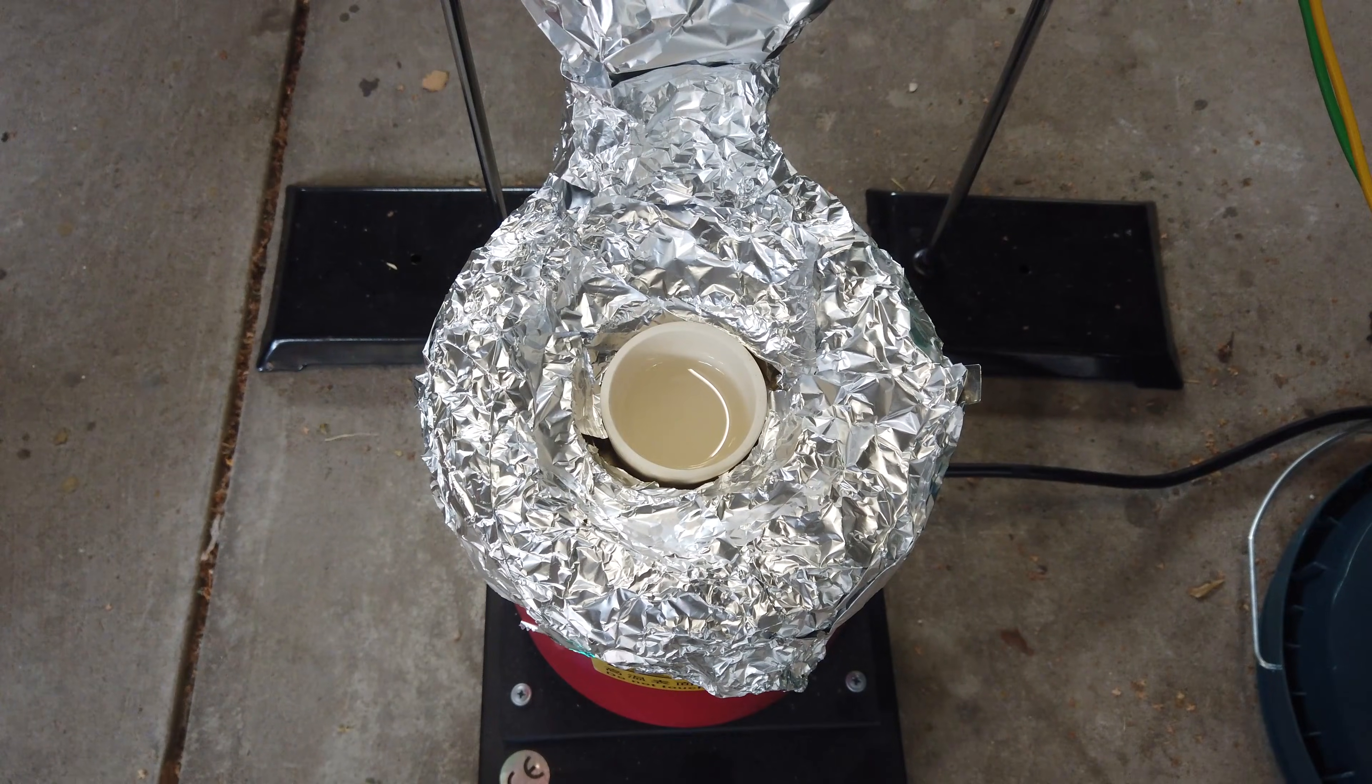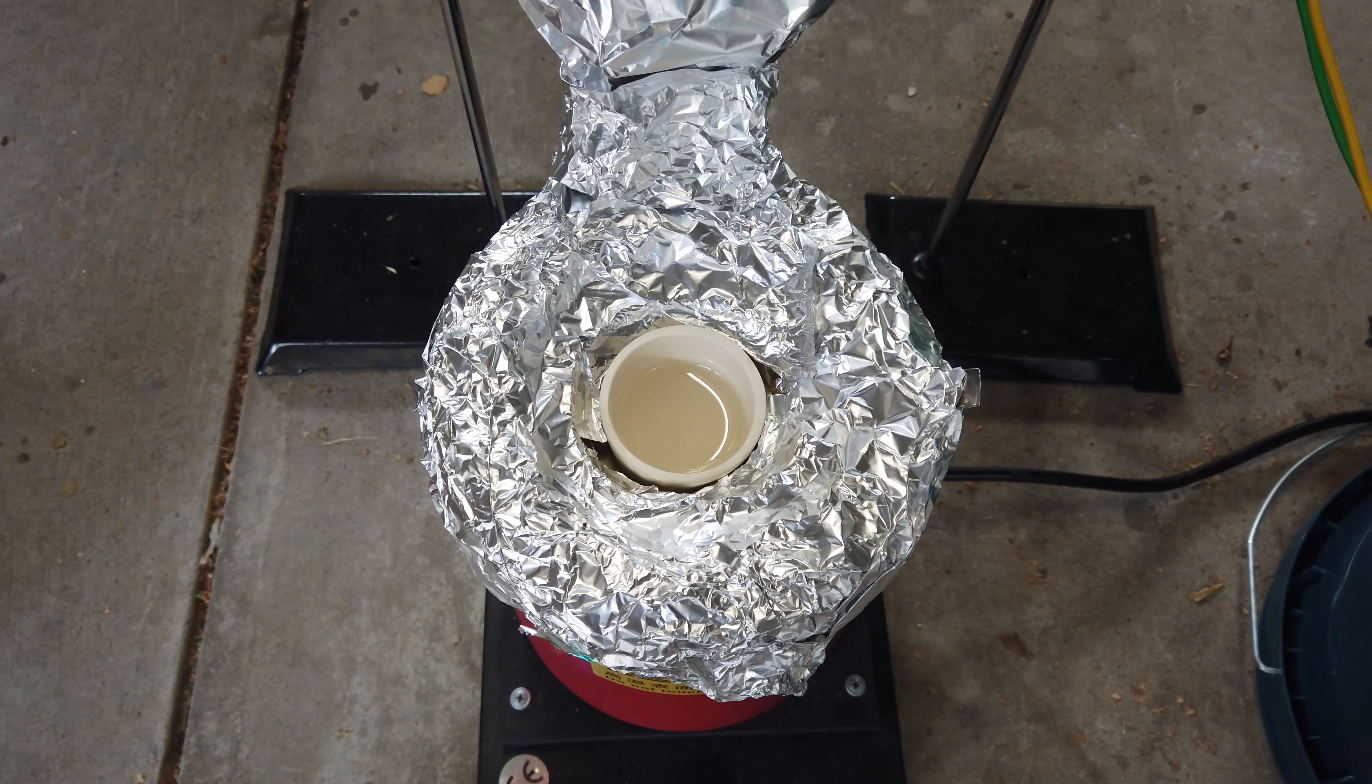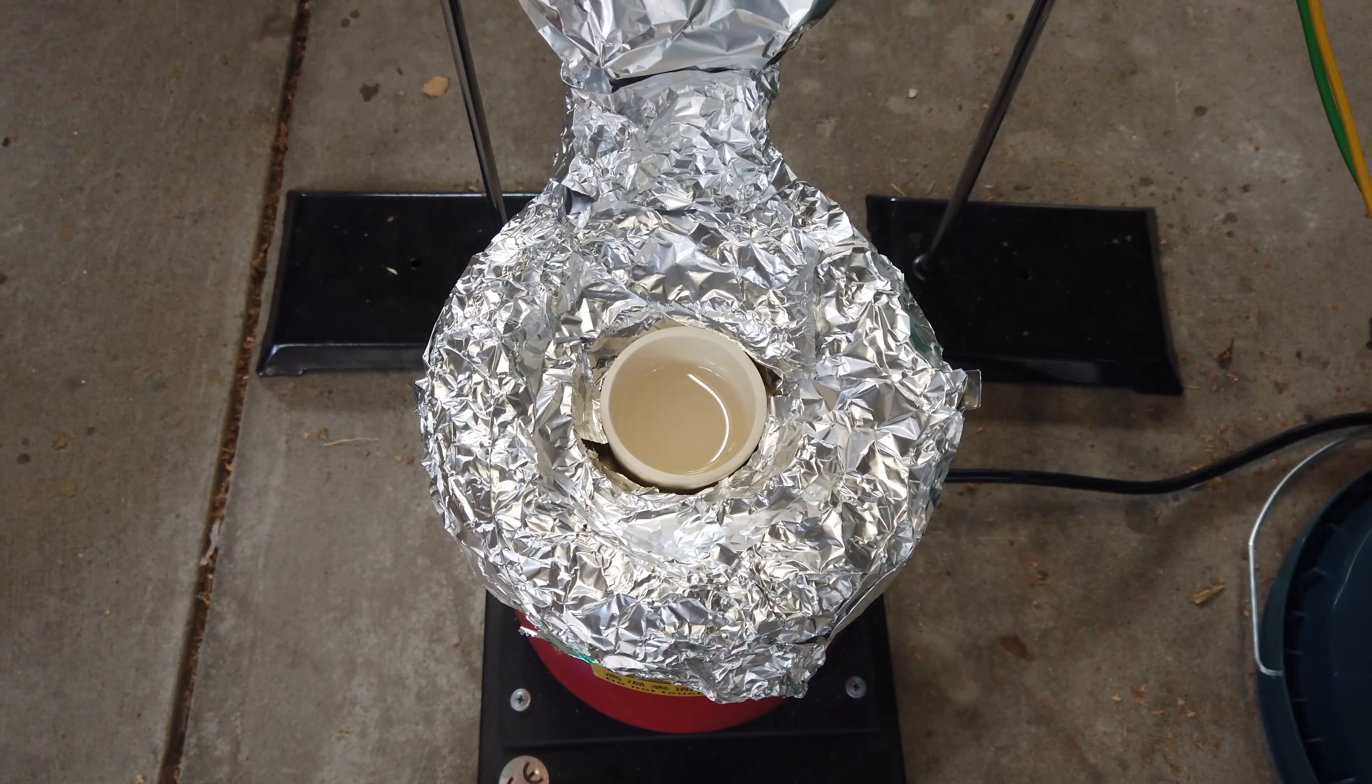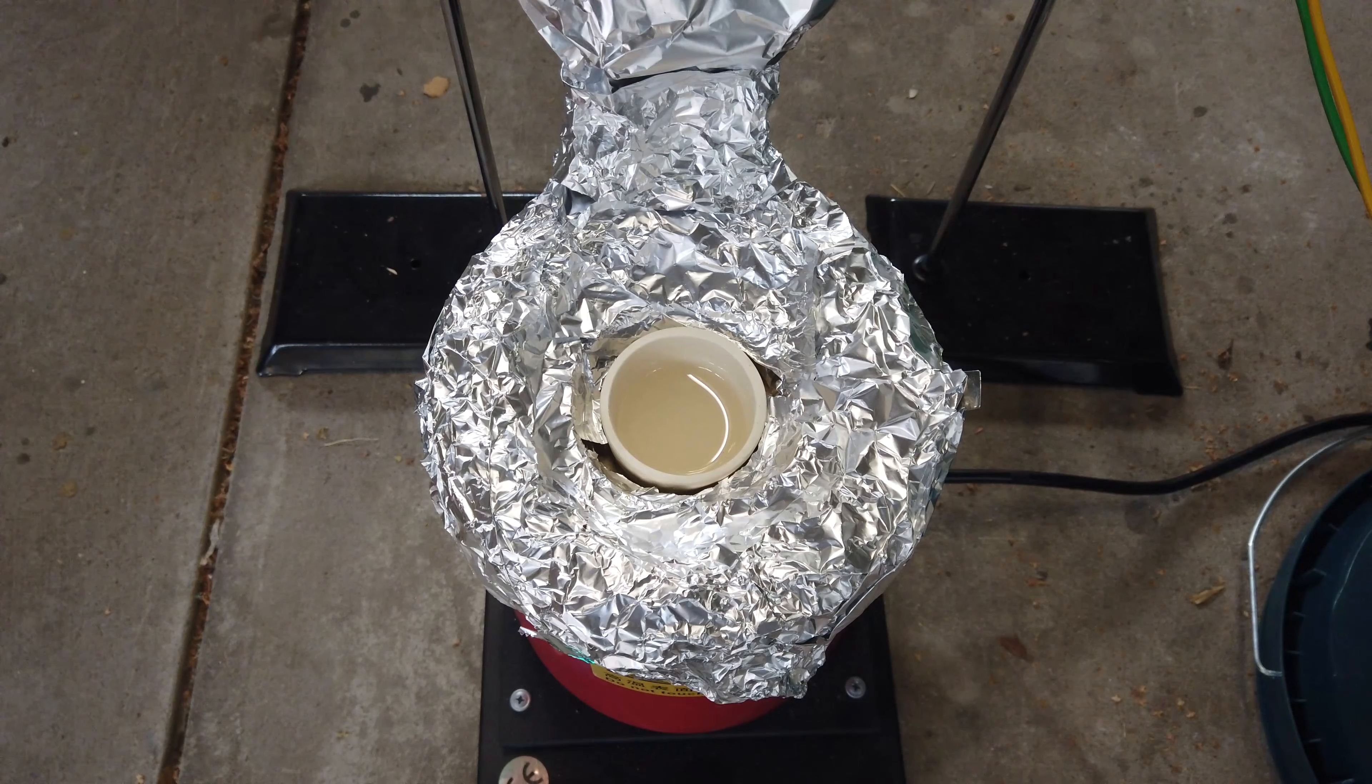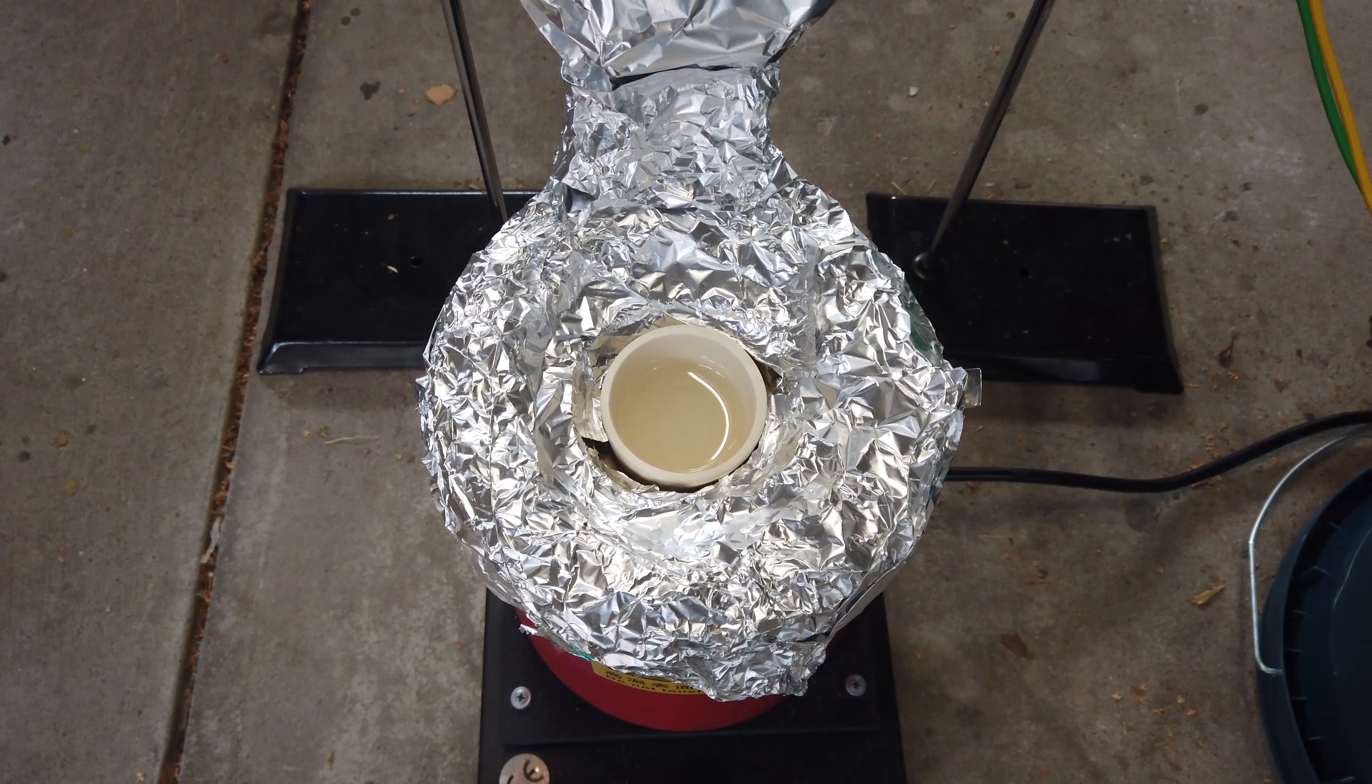I'd really like to see the molten sodium hydroxide in this thing and it not go brown from the stainless steel crucible. And isn't that cool? The sodium hydroxide in the crucible just kind of sits there. It's not discoloured or anything, it just kind of looks like water. A bit scarier than water—this is molten sodium hydroxide at over 300 degrees Celsius. And you probably have noticed this before, but I've covered the rest of my furnace with aluminium foil. That is just to keep the inevitable splatter of molten sodium hydroxide off the rest of my furnace. Anyway, I will put the electrodes in and we'll see what happens when we electrolyse this.